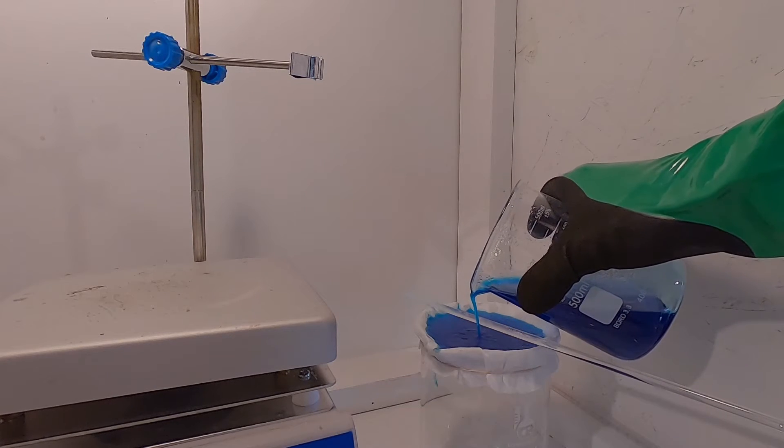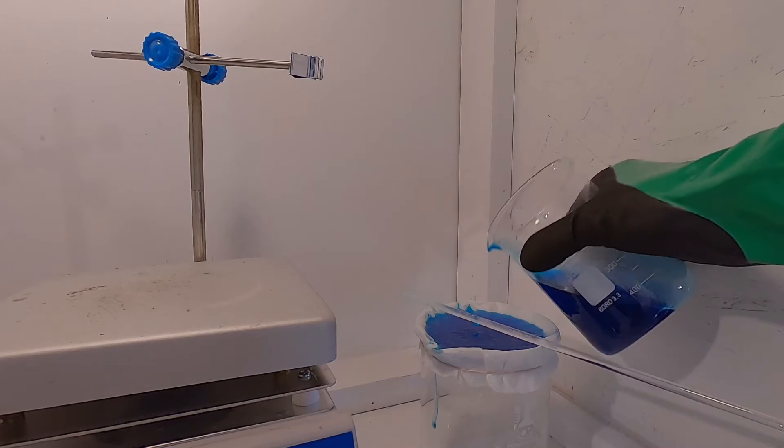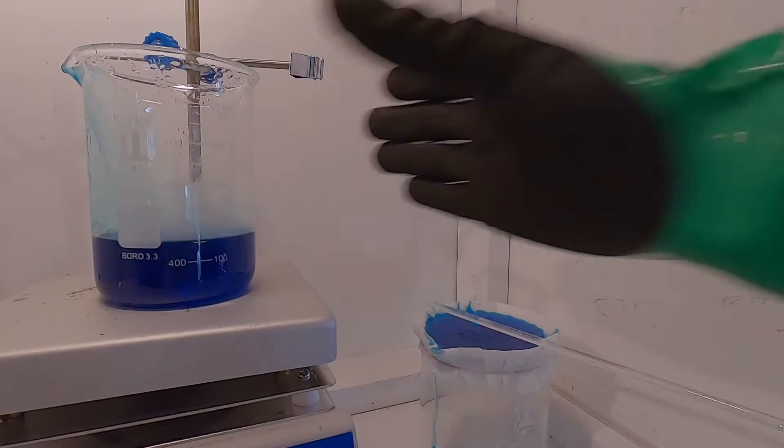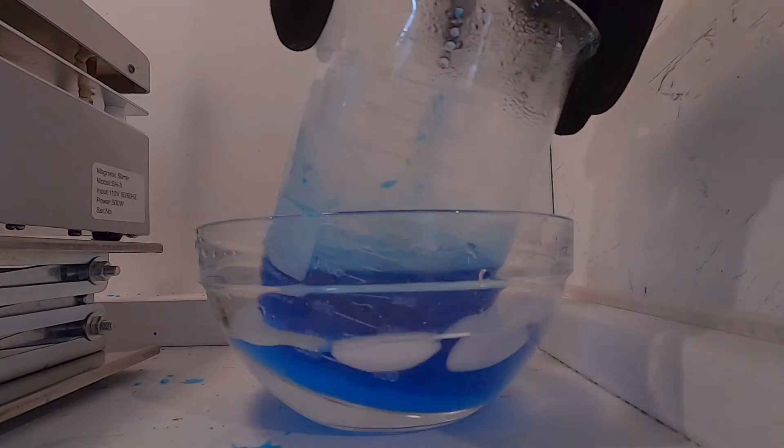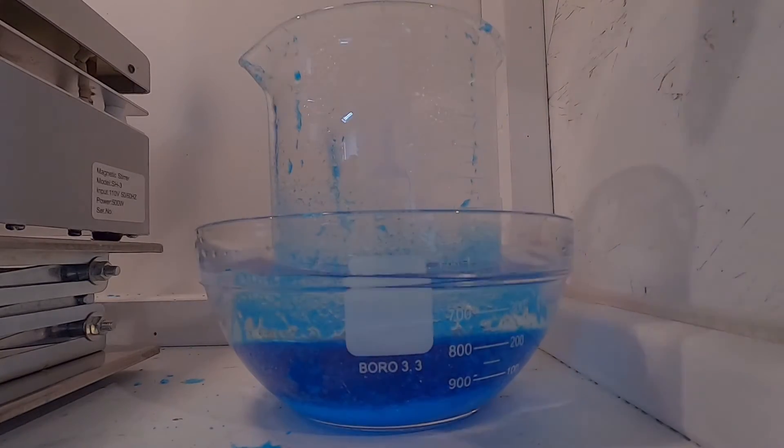Slow cooling makes bigger crystals, fast cooling makes smaller crystals. Weighing copper sulfate is easier with smaller crystals, so I will cool this in an ice bath.